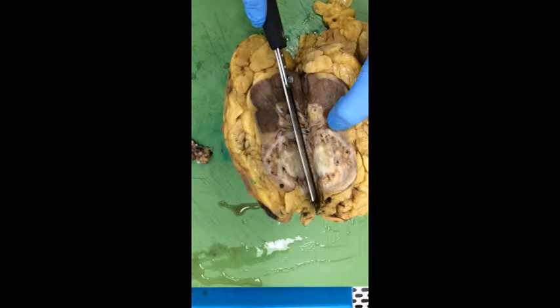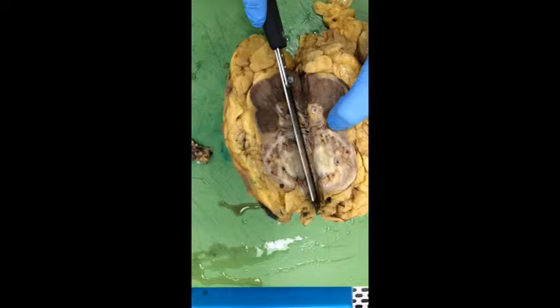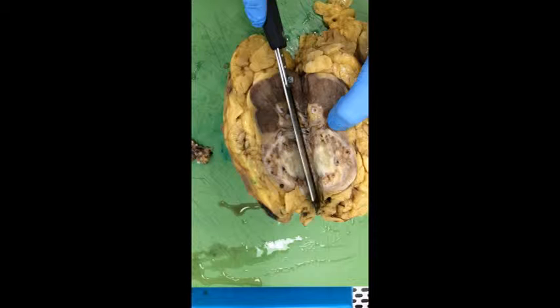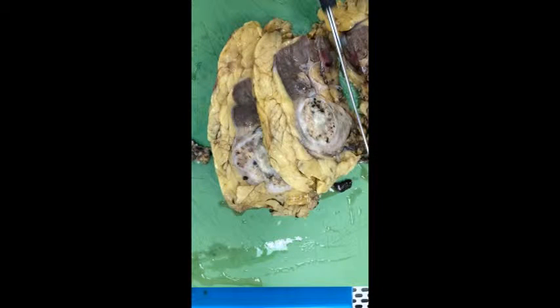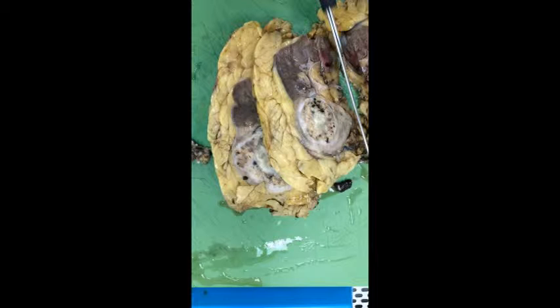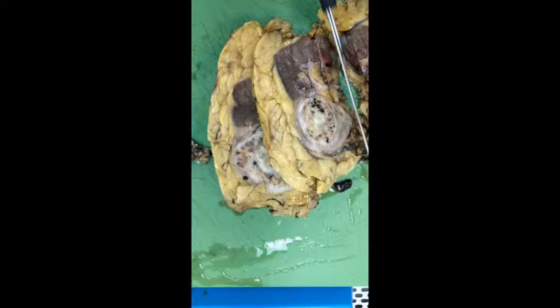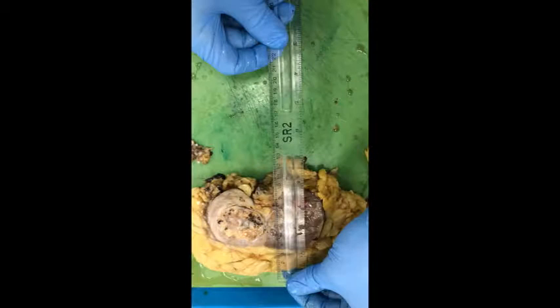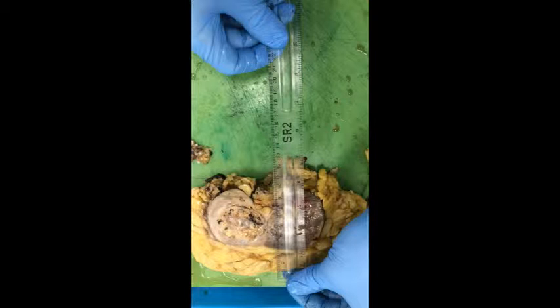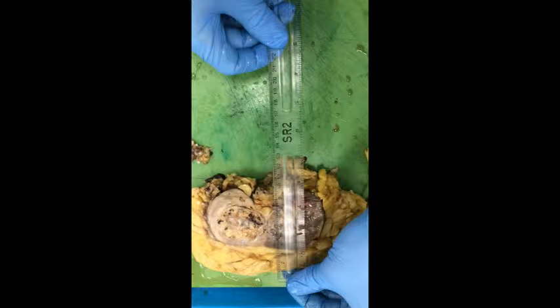The next stage is to open the kidney completely, examining for the kidney tumour. Photograph this at this point. Measure the perinephric fat, the kidney, and the kidney tumour itself.